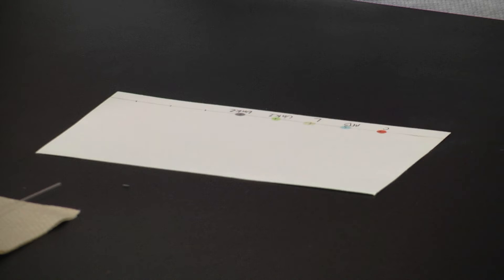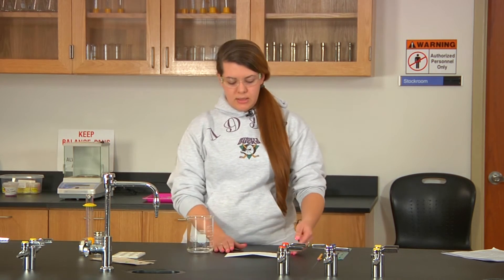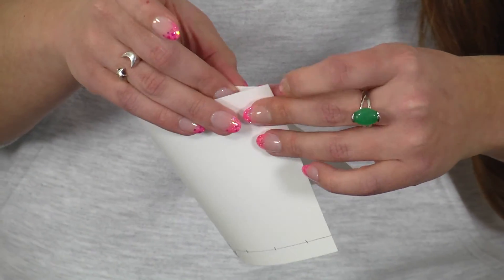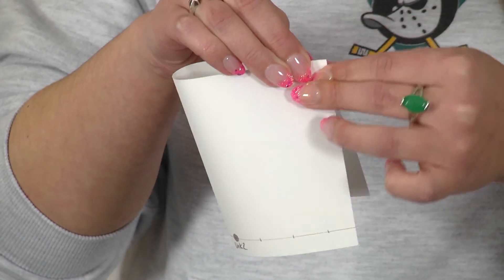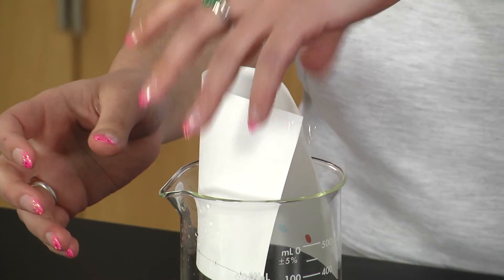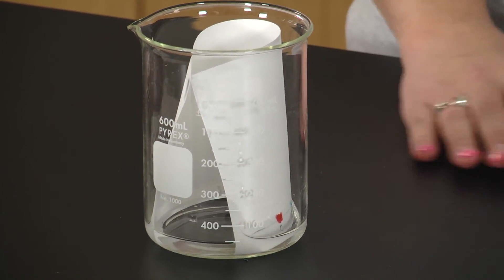Now that you've spotted your paper twice, get 30 milliliters of deionized water and put it in your 600 milliliter beaker. Then take your sheet and a piece of tape, fold it without making a crease, and tape the edge. Be sure not to go in too far so the spot isn't in the same line as the tape. Place your sheet into the beaker, trying not to let it touch the sides, and let it sit for 10 minutes.